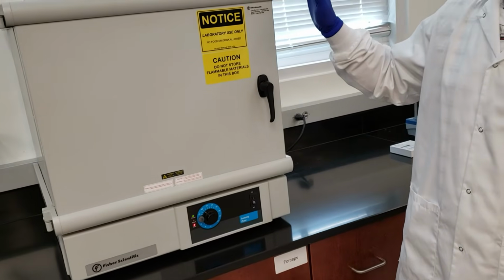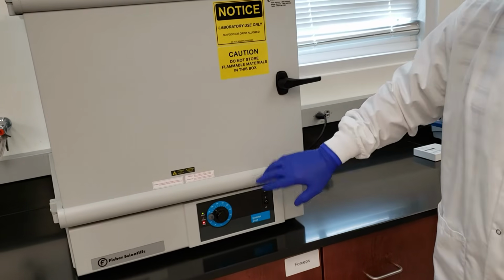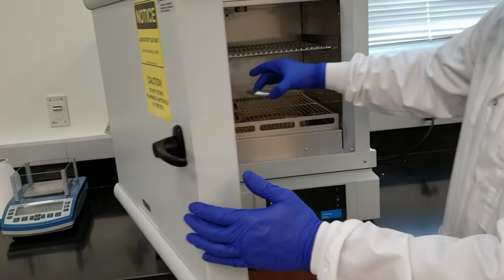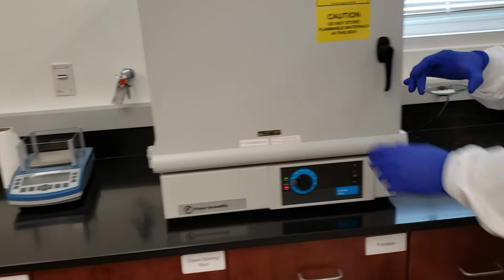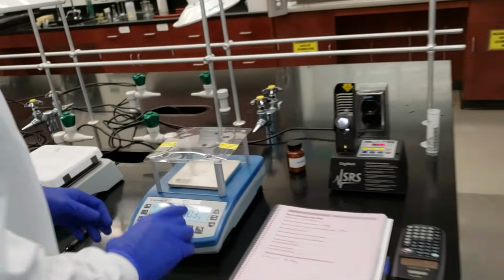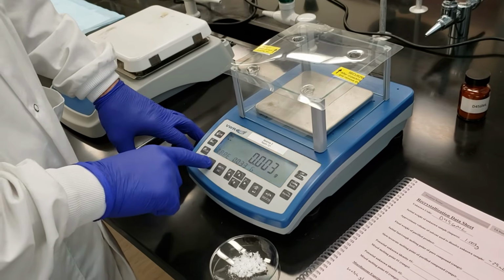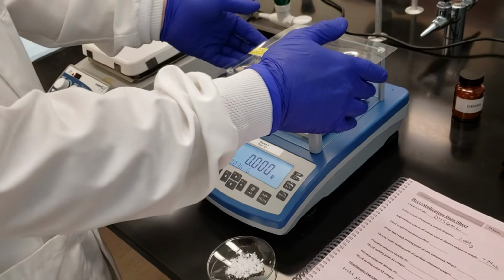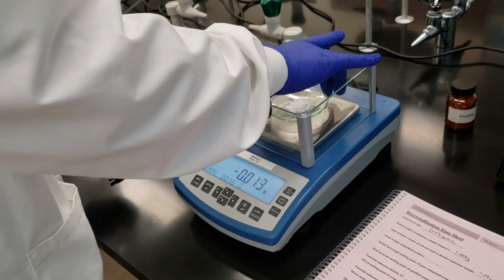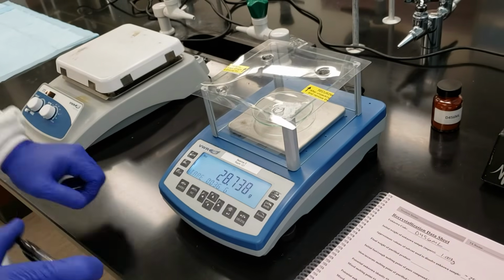Right, so our compound is ready to come out of the oven. So we've got our crystals in here cooking at about 100 degrees Celsius. Let's go ahead and remove them and take them over to the balance and find out what our percent recovery is. First things first, we've got to make sure that our system is tared. We'll take off the top here. Add our crystals in our watch glass. And record our weight.